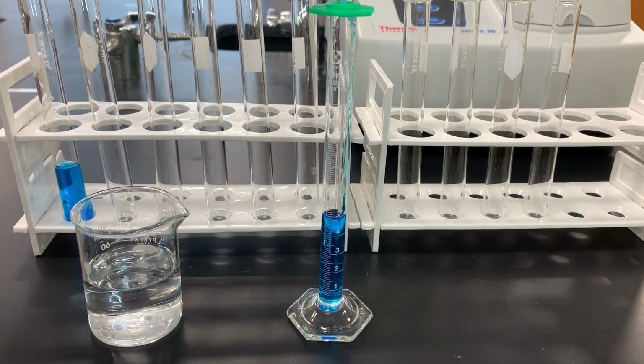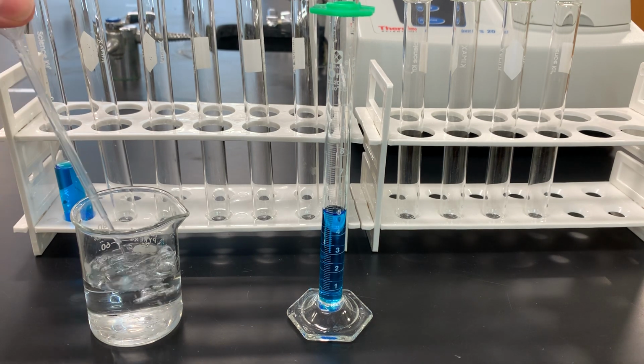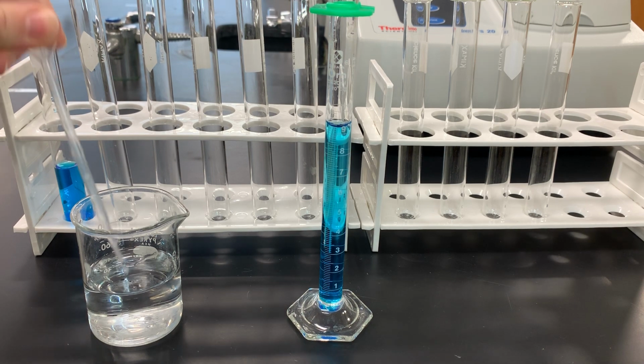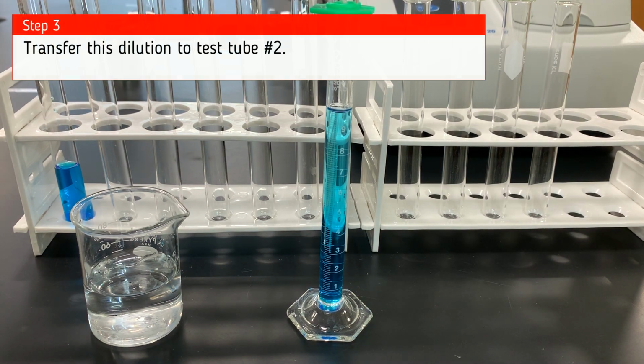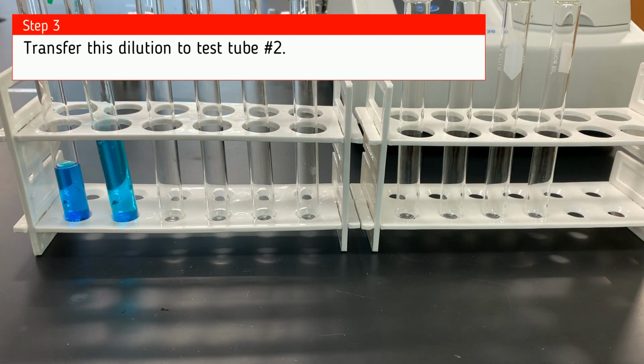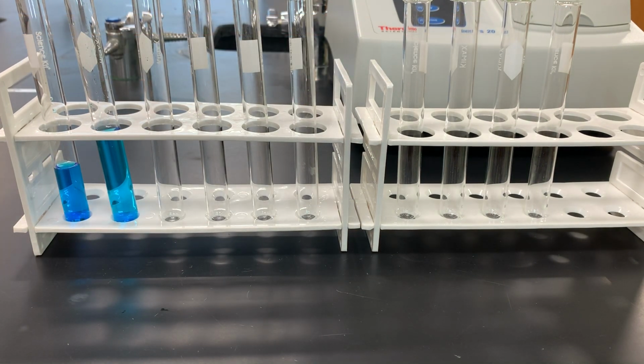So we need to make sure we're as precise as possible with this, so we have good dilution measurements. So I added 5 milliliters of my concentrated stock solution to the graduated cylinder, and then 5 milliliters of water. This is my first dilution, and I put it in test tube number 2.